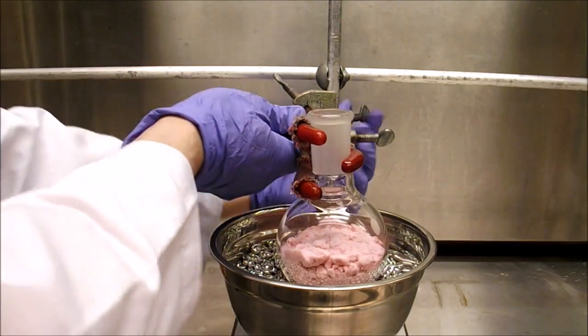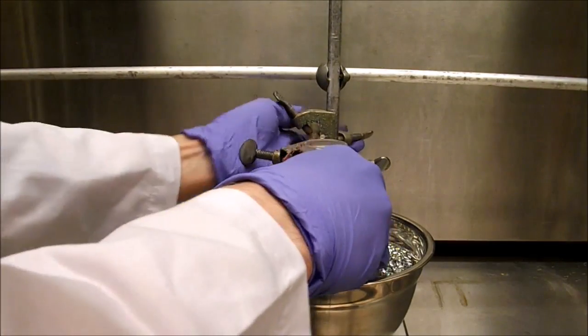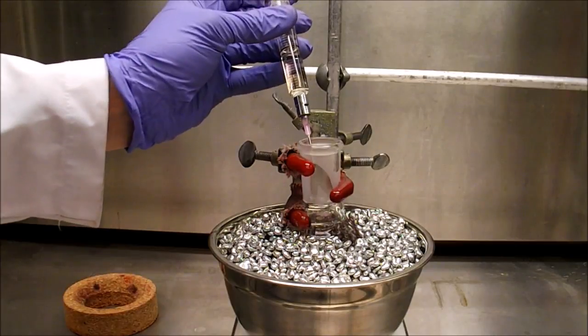We like to use bead baths in place of oil baths because they reduce the fire risk and keep the lab cleaner than oil baths.